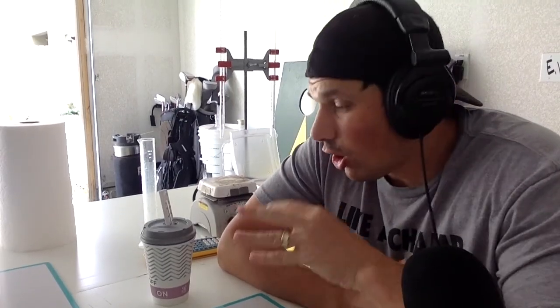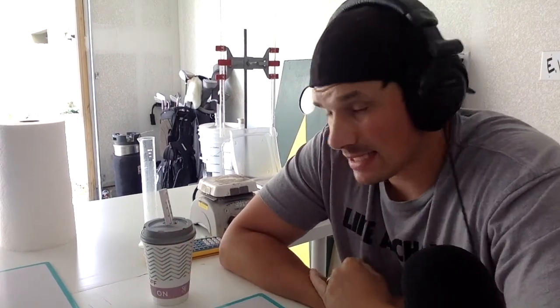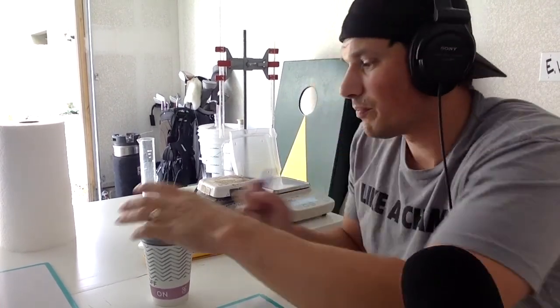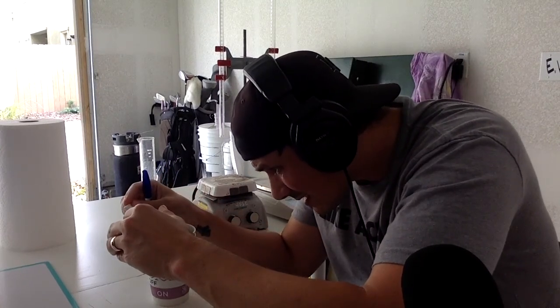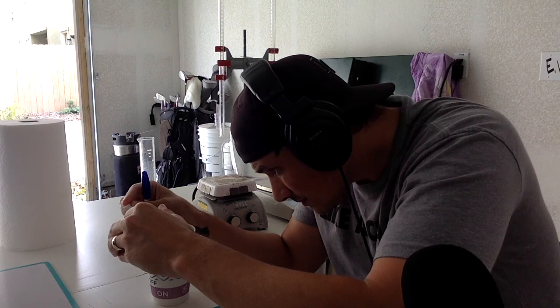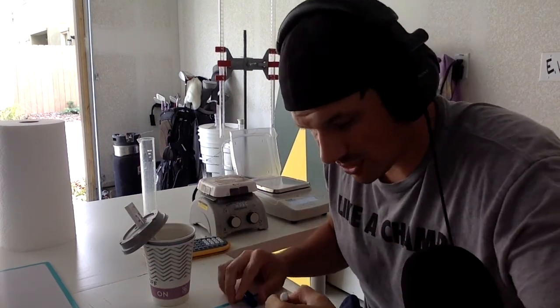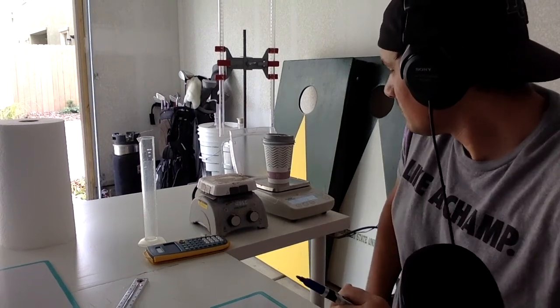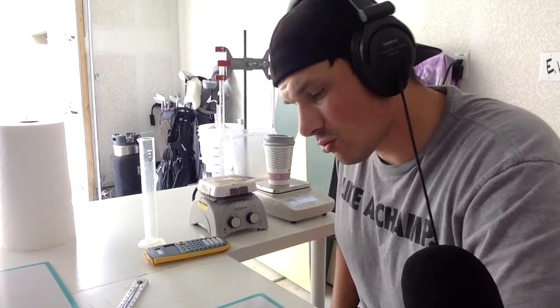All right, you guys, we're back. So all the ice is melted. I'm not going to lie. It's probably been about half an hour of me just sitting here. But I have a final temperature. Let's get the final mass of the water because what we need to do is see how much ice is actually melted. We have the initial mass of the water. We're going to get the mass of the ice melt. And then that'll tell us the exact mass of ice that melted. Total volume minus initial volume is what I melted. From there, let's do some calculations and we're good to go. So it looks like my final temperature is about four degrees Celsius. Pretty good. So I'm going to do four degrees Celsius and let's get this final mass. So I'm going to take my thermometer out. Let's weigh this thing. It looks like 149.53 grams.